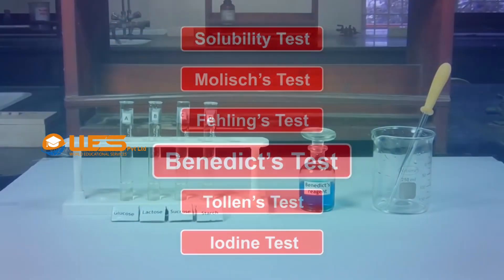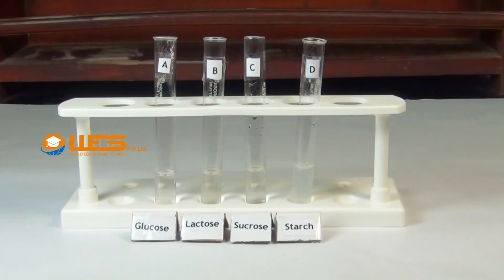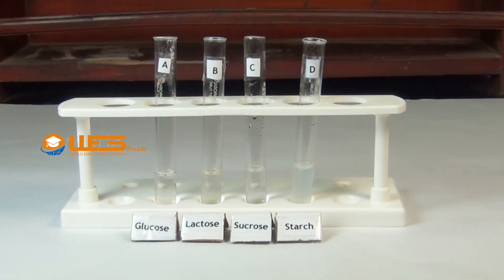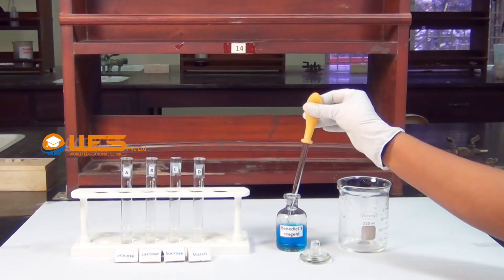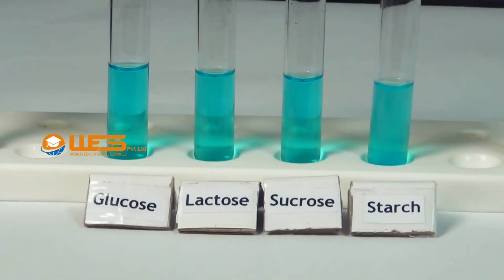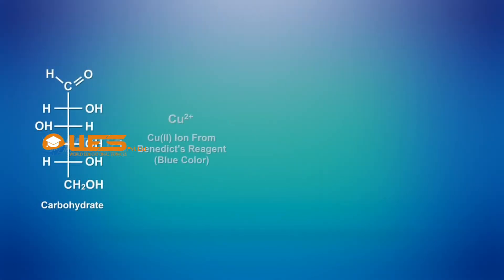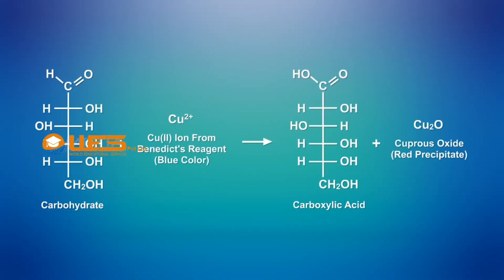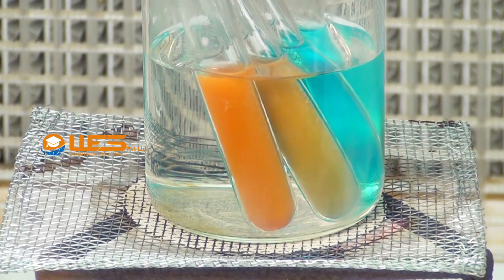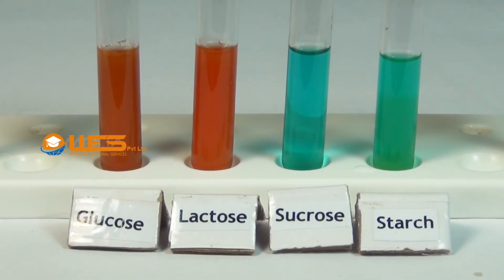Benedict's Test. Take a small quantity of aqueous solution of glucose, lactose, sucrose and suspension of starch in four test tubes A, B, C and D respectively. Using a dropper, add a small quantity of Benedict's reagent into each test tube. Heat the test tubes in a boiling water bath for some time. The reducing sugars, glucose and lactose, reduce the copper ions in the reagent to form a red precipitate of cuprous oxide, whereas no such precipitate is formed from the non-reducing sugars, sucrose and starch.